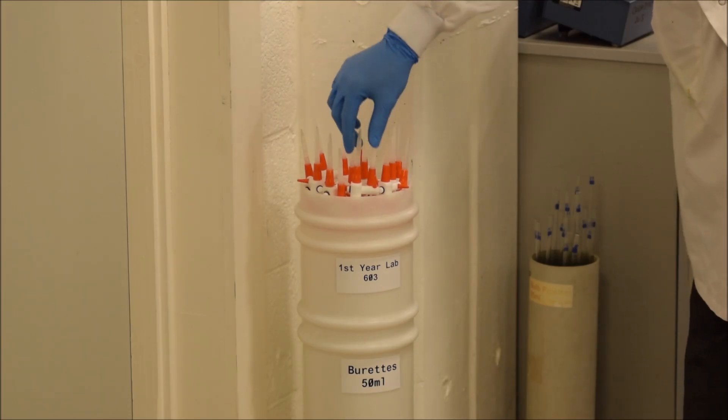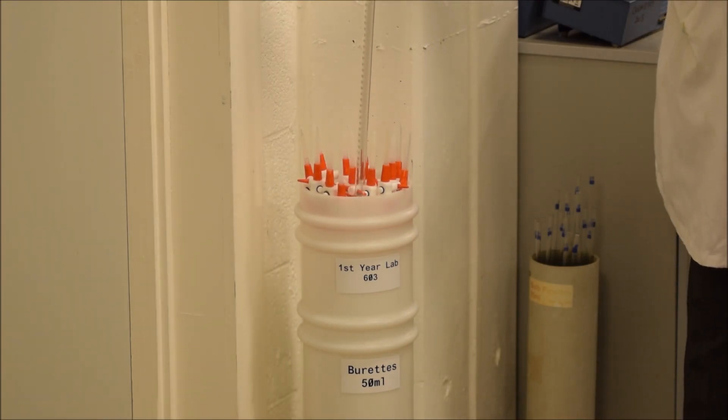So you'll find the burette in your lab in the burette container. When you're taking your burette out of the burette container, be a little bit careful and take it out gently. And if you want to put it back in, you also have to be a little bit careful.